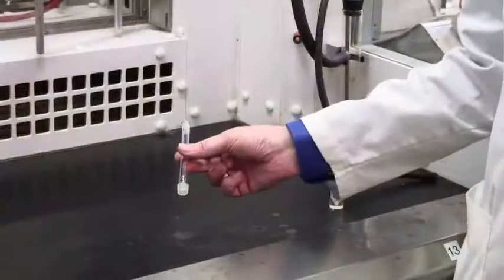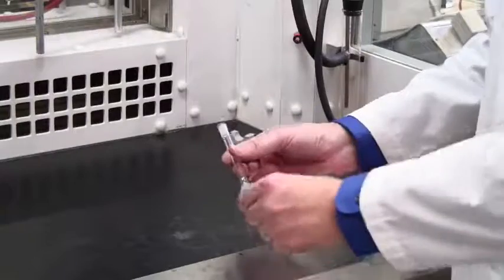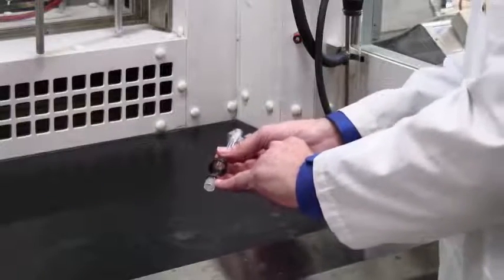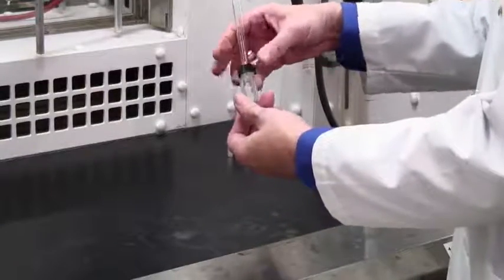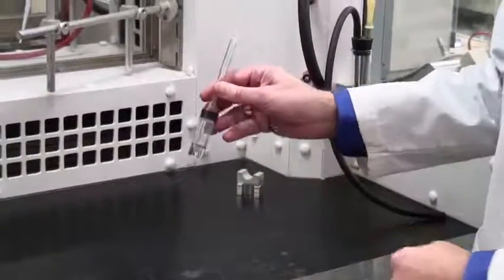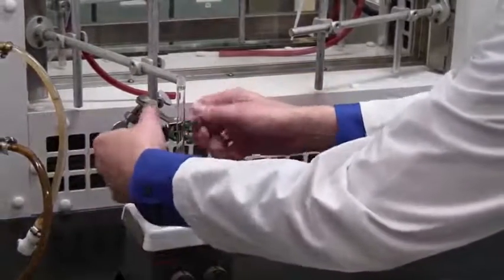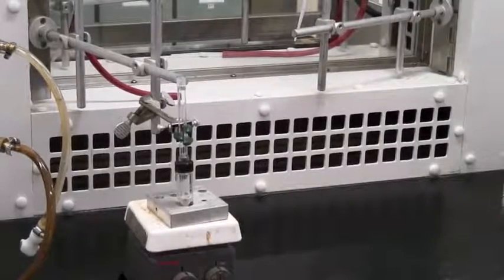An air condenser is basically a glass tube with a ground glass joint at the end. First, put a fitted threaded ring over the top of the joint, then roll an O-ring to just above the ground glass joint — this will act as a seal. Then take your reaction vessel, place it inside, and screw it together. This is now assembled and ready to heat. Place it in a heating block and clamp it — this is how it should look for a reflux reaction.